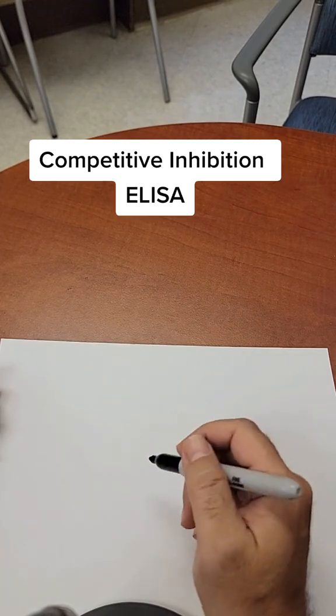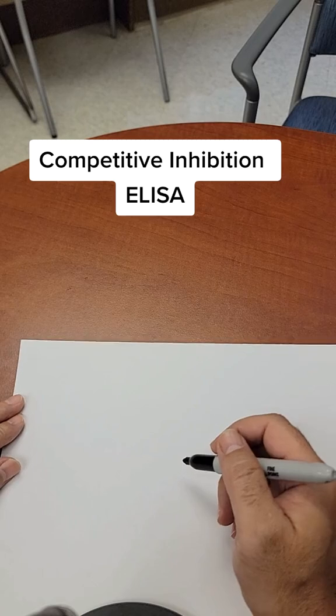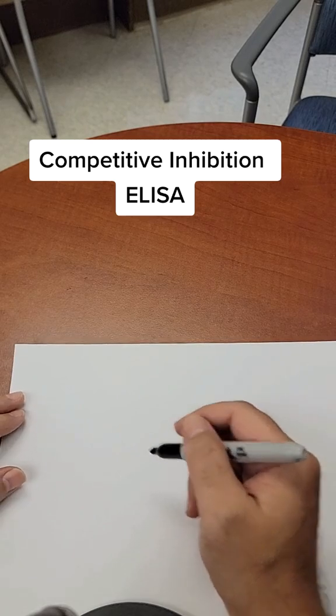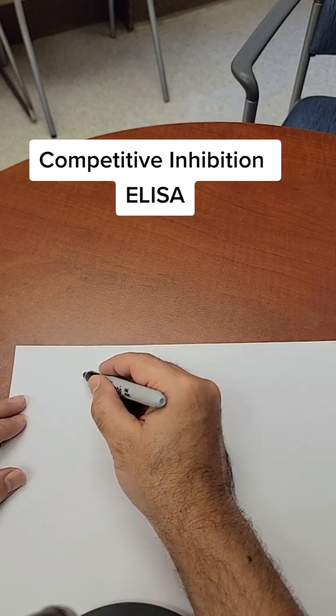Competitive inhibition ELISA is very similar to the radioimmunoassay, a video that I did a while ago. So here's how it works.